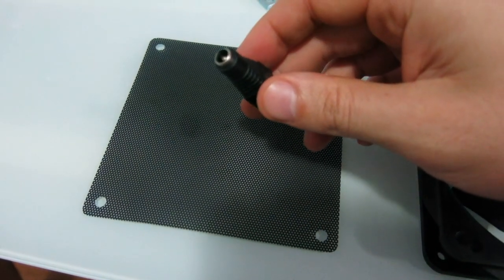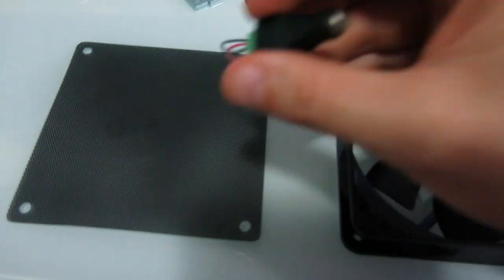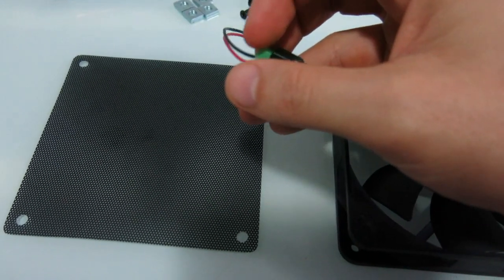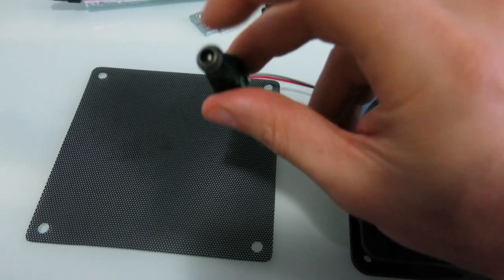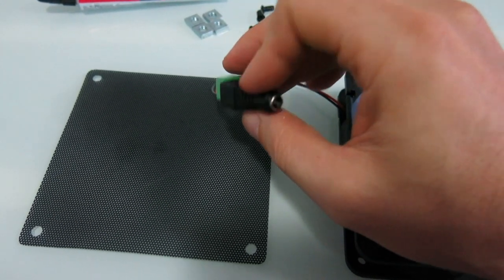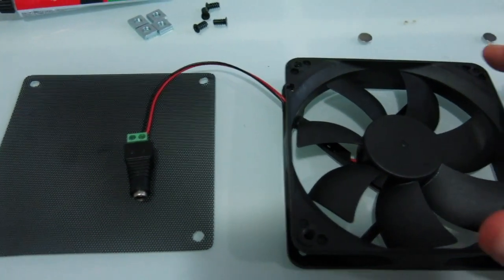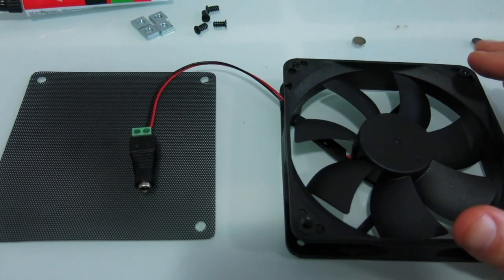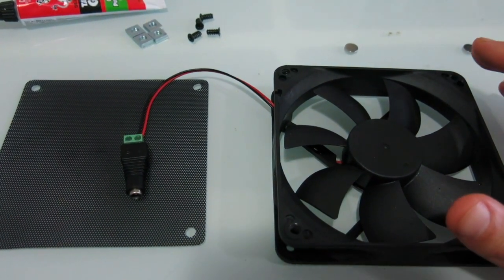So the other thing I bought for this is just a little plug, because the plug that came with this fan was a 2-pin thing that I couldn't find a suitable outlet for, so I bought this from Jaycar, and it already goes with an existing power outlet that I've got for my cold water motor for when I'm recirculating for my lagers.